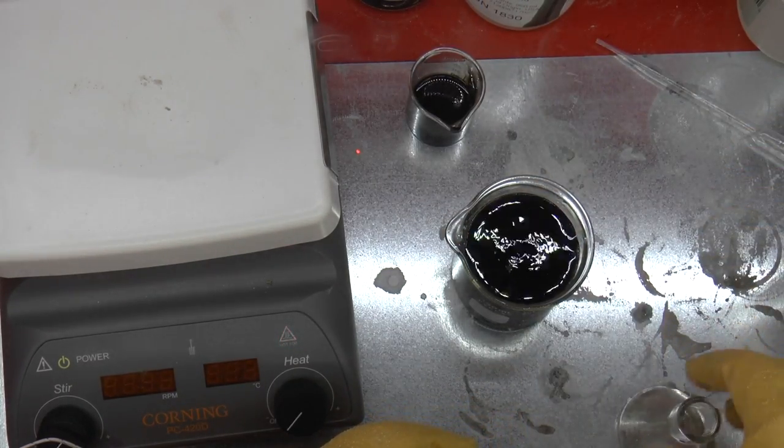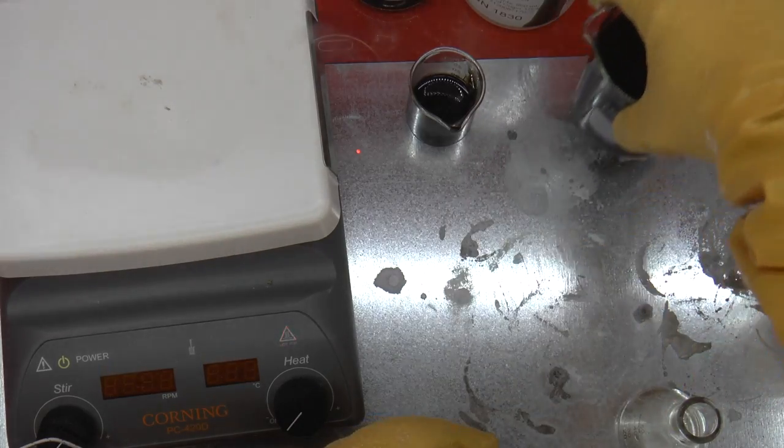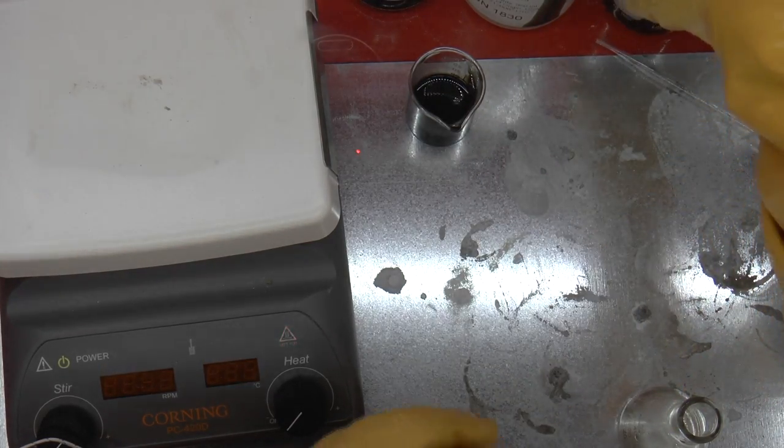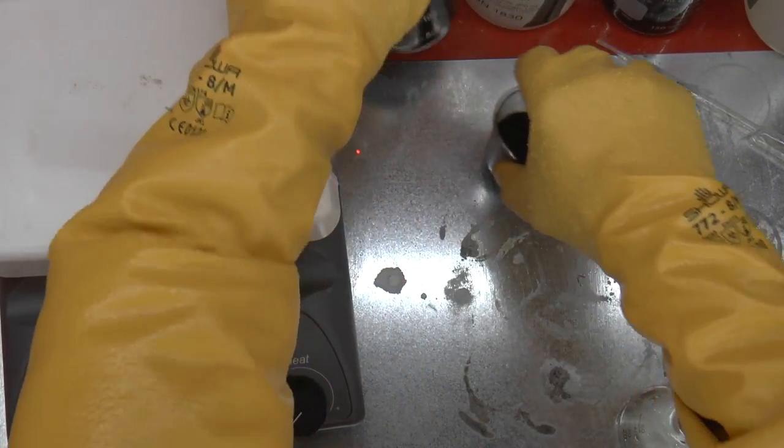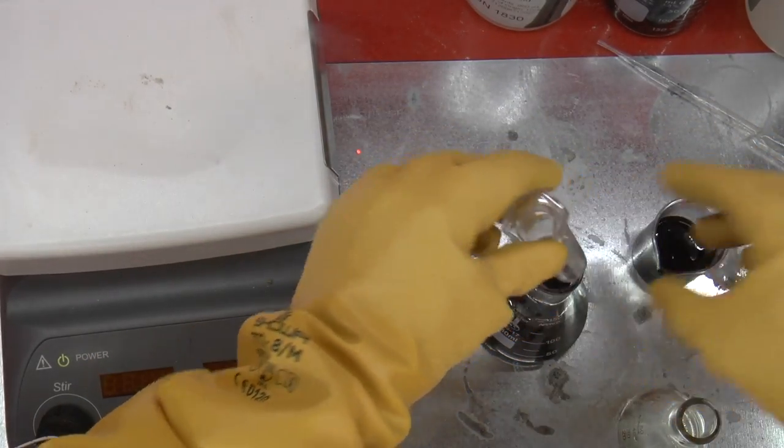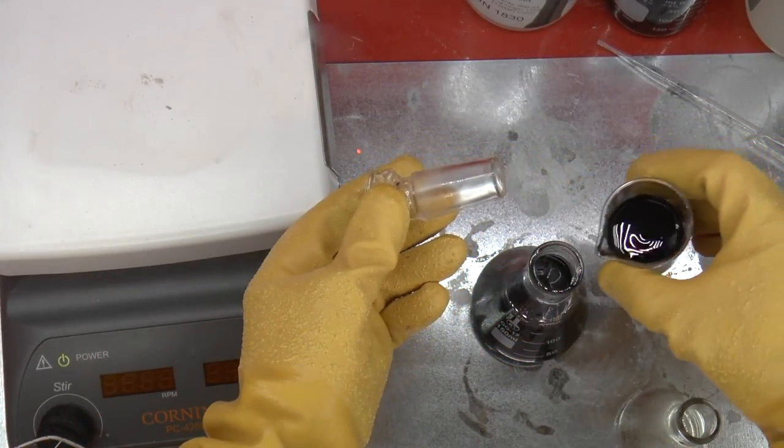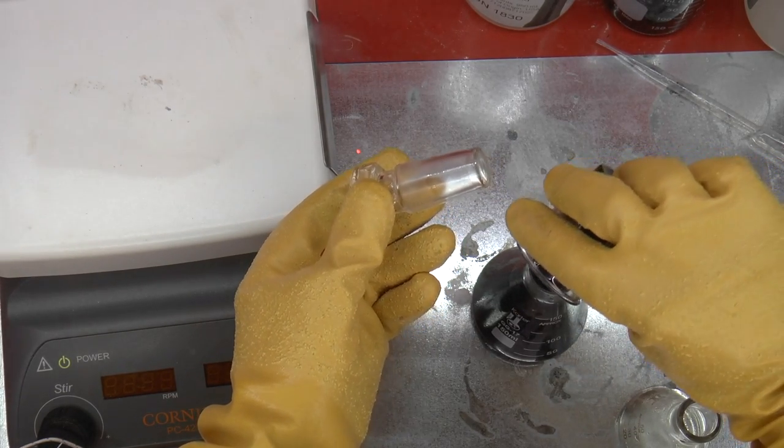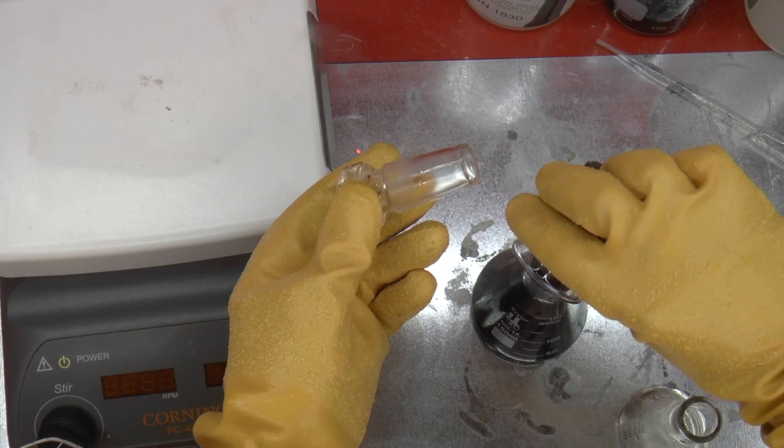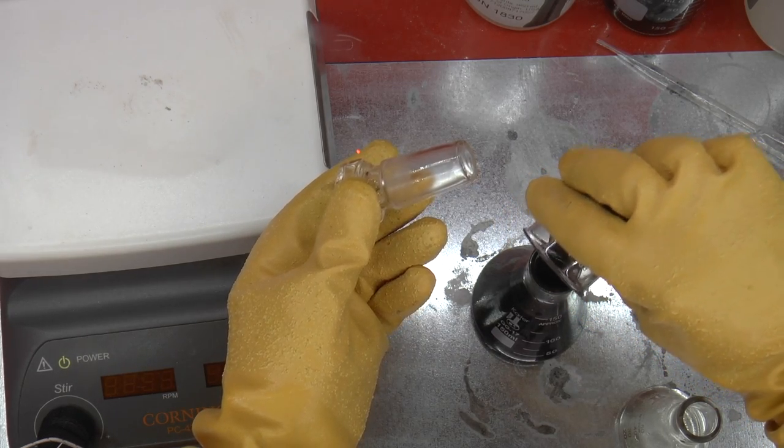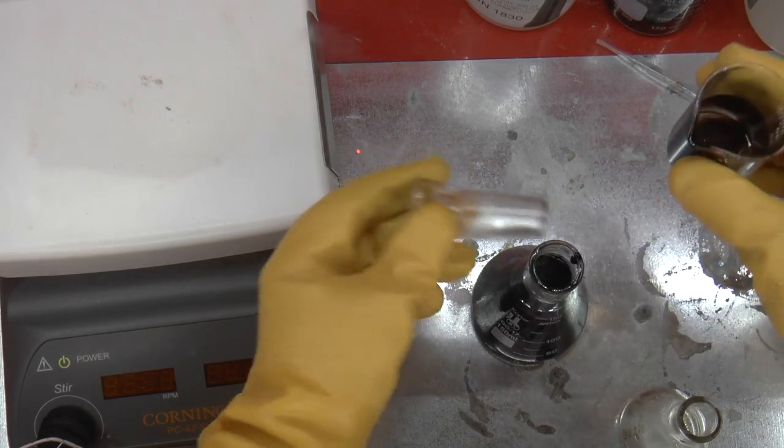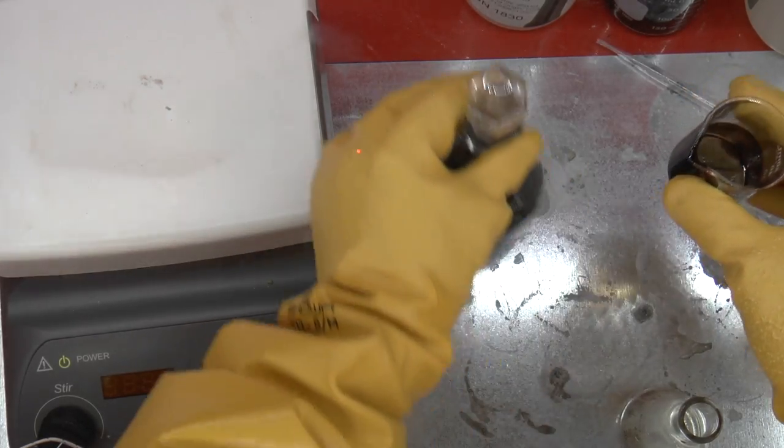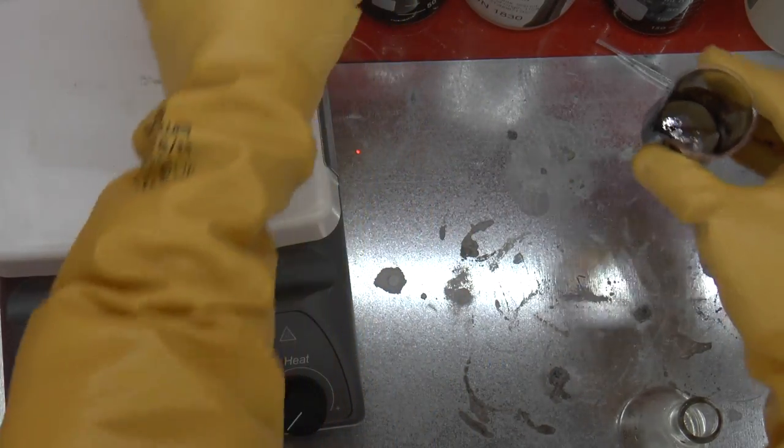And there it is. Let's take a look at it a little closer. But first, let's tidy up. I'm going to put my beaker of watery acid aside. And this is the flask that I'm keeping the used acid in until I can distill it. I'm just going to pour off whatever I got and store it until I can distill it off. Great. Everything's clean. I can now move on to the next step.